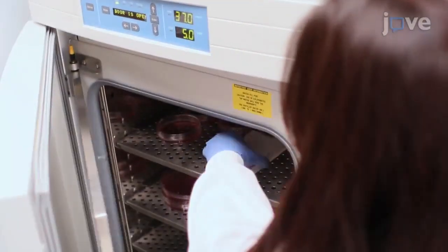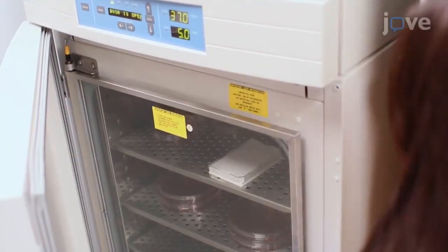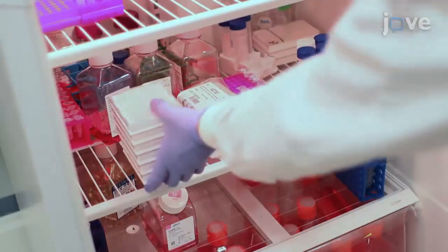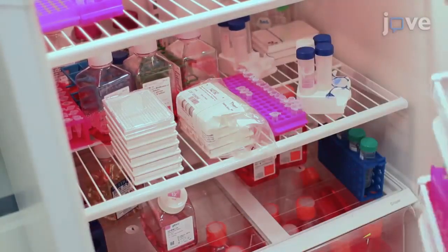Then incubate the plates needed for cell seeding at 37 degrees Celsius and place the rest of the plates at 4 degrees Celsius for long-term storage.